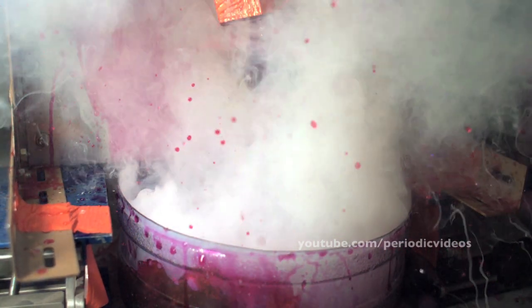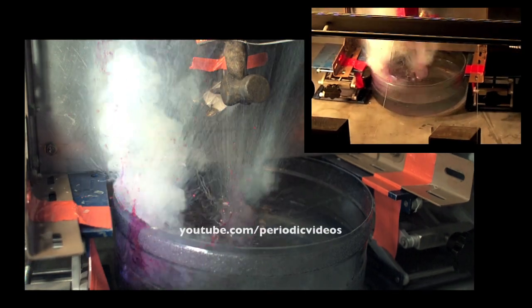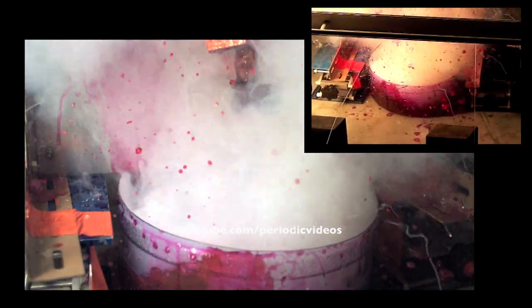The interesting thing is that if you watch carefully, there's another explosion — not just one, but the whole thing starts all over again, and there's another eruption with a flexing of the plastic bowl. What I think has happened is that when the tube goes into the water, water rushes in and reacts with the rubidium, producing explosively an amount of hydrogen. That great rush of gas blows all the water out of the tube, so the reaction stops, and then the water goes back in again and you get another reaction. Perhaps that happens two or three times, by luck.